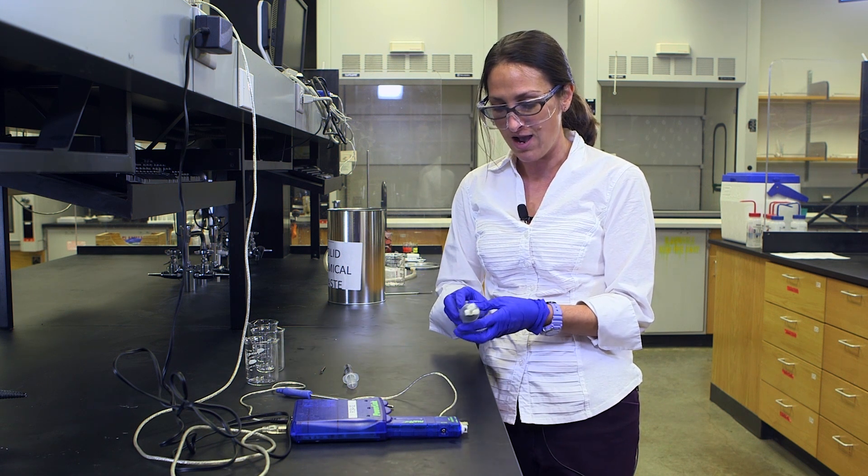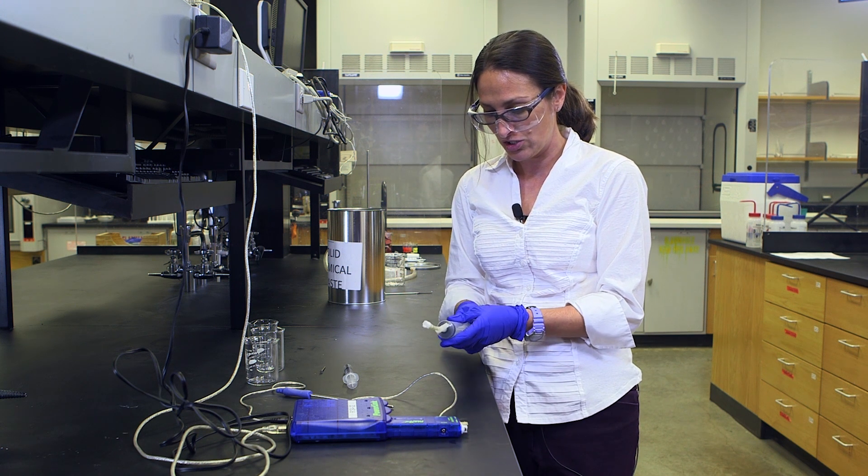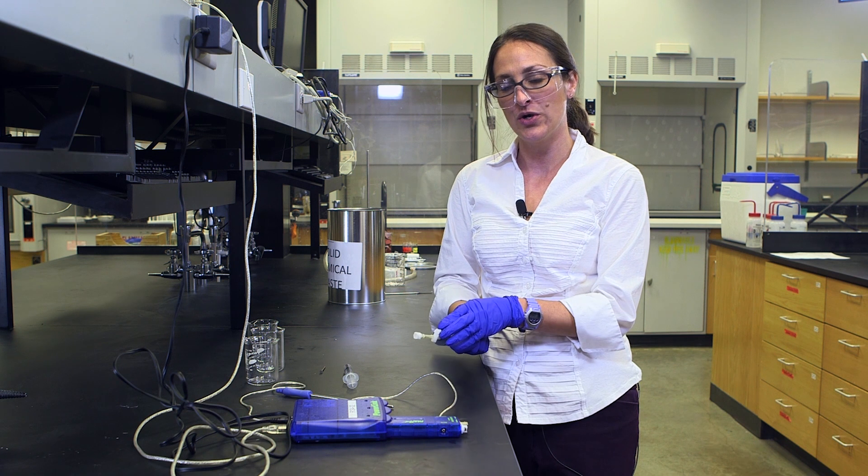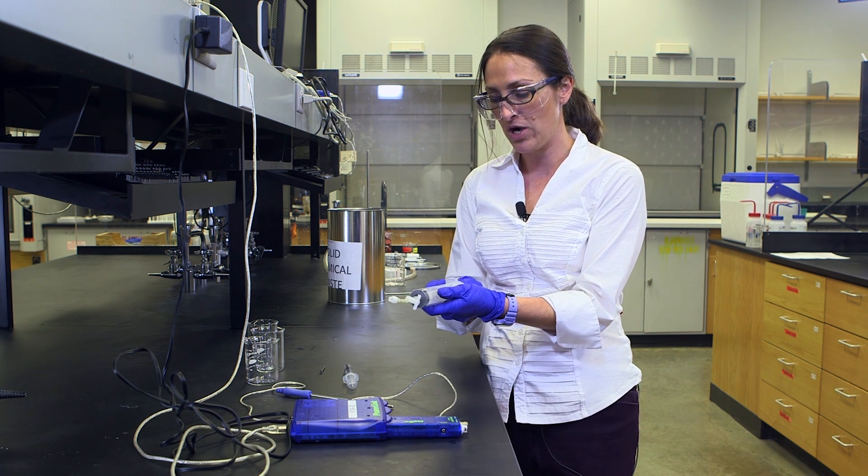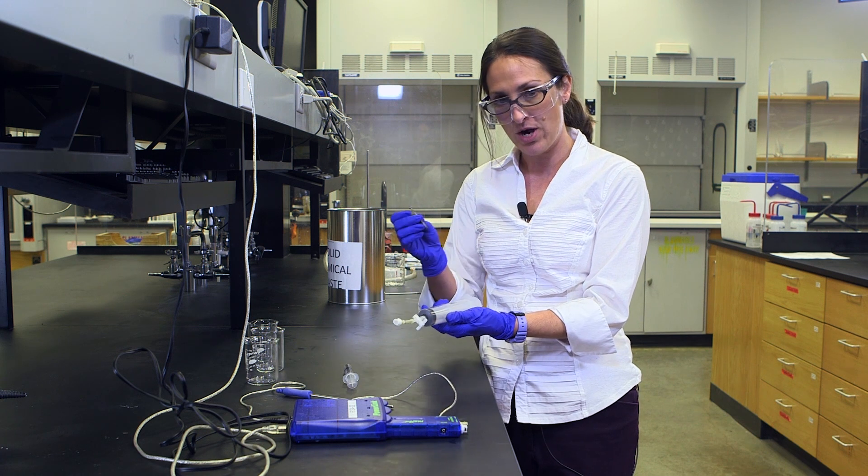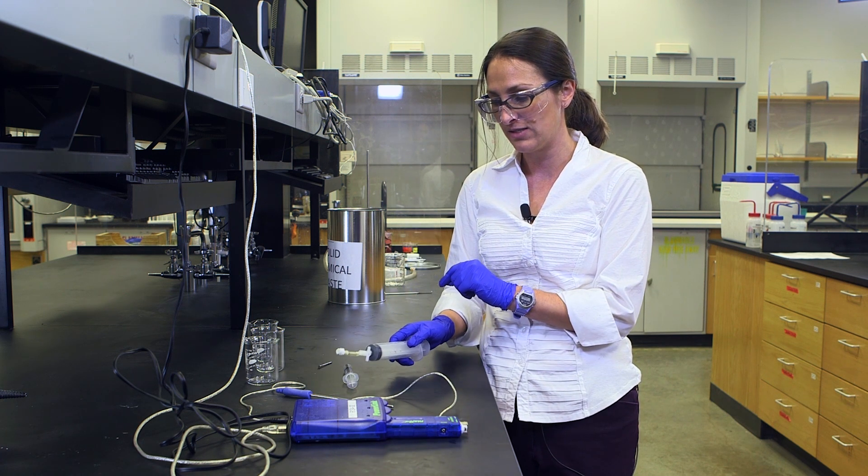Finally, for Avogadro's Law, you're going to use the same technique we showed earlier where you will close the syringe, one partner will pull back, the other partner will insert the nail stop, and you'll weigh the evacuated syringe.